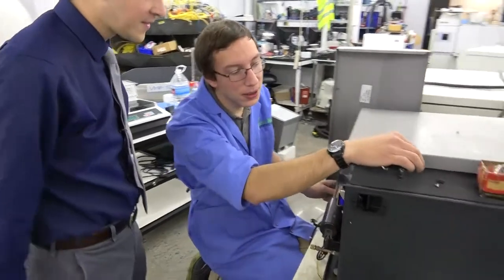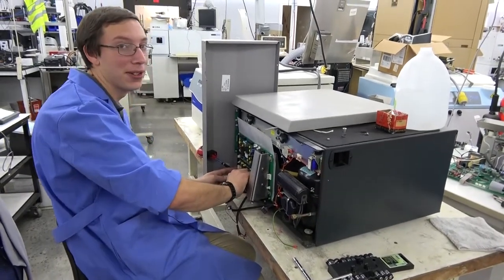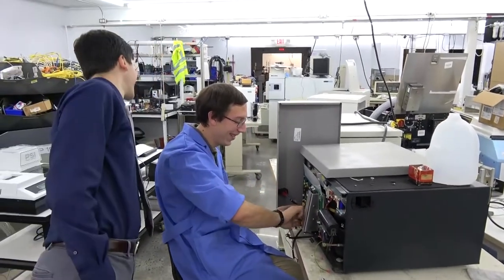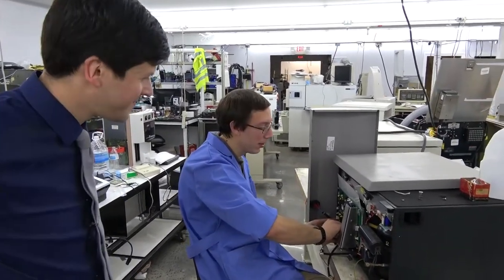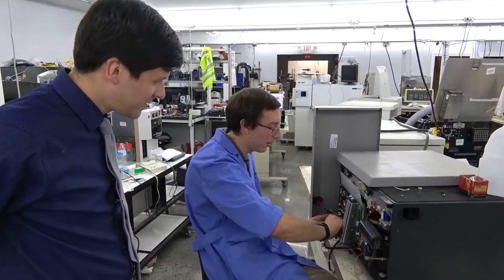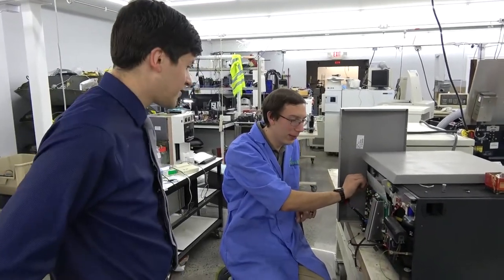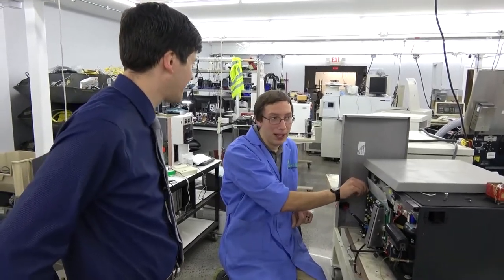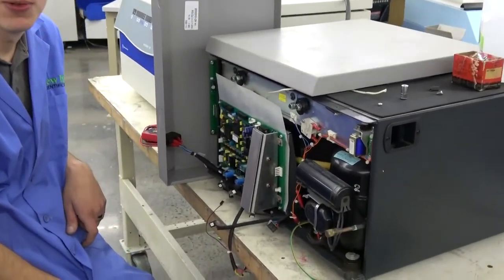Well, this is an unusual circumstance — it's a parts unit. A centrifuge that doesn't work? The main board's bad, so it's going to cost too much to repair. The centrifuge itself is a Jouan — nobody here can quite agree on how to say that name. It's been sitting upstairs for a while. I decided to take another look at it with new knowledge. It's only about a $500–$600 centrifuge when working, but the board itself is about $600–$700. Easy choice — when the main board's gone on this era of centrifuge, you either have another good board from a used unit, or it's over.